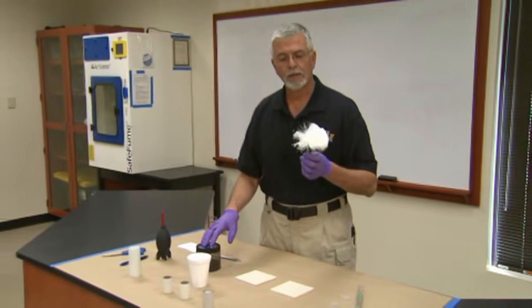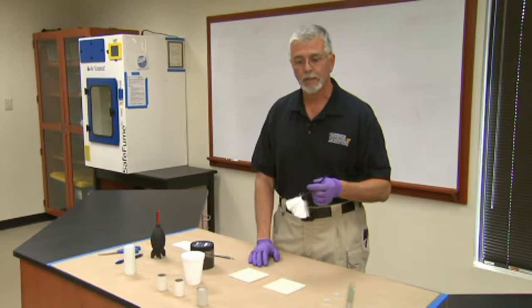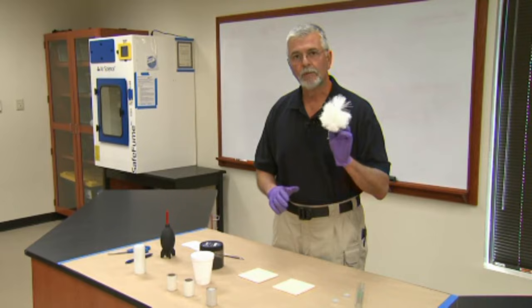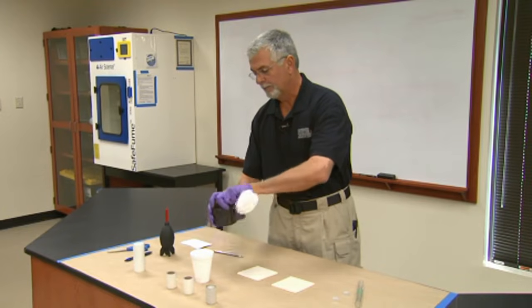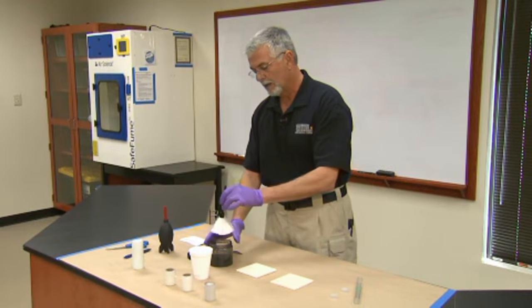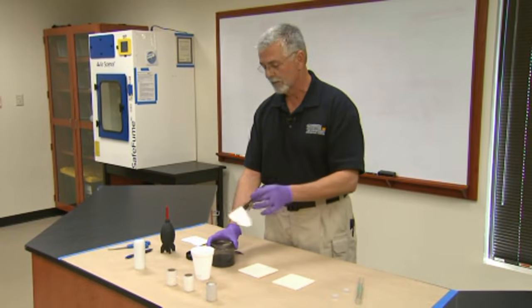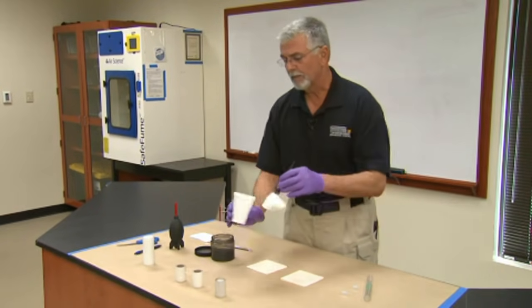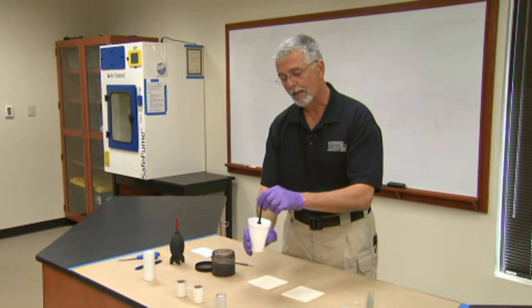They also make disposable brushes with one-time application use, which you can discard if you're worried about DNA or cross-contamination. But if we're primarily just processing for fingerprints, that's not such a consideration and we'd reuse the brush. Some people teach loading a brush by dipping it directly into the original jar — this is not recommended because of contamination issues and because it continues to compact the powder in the jar.